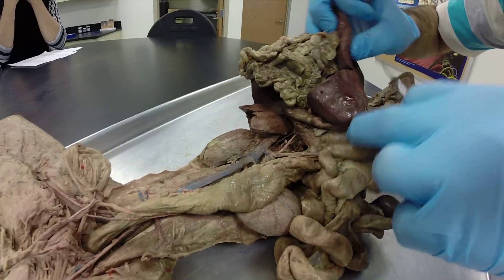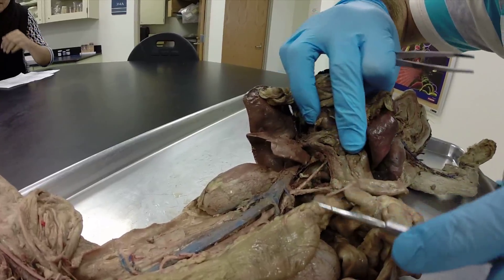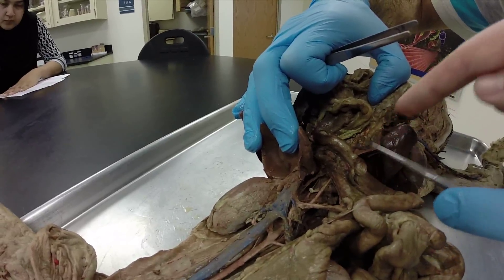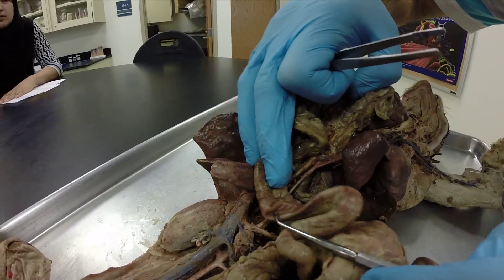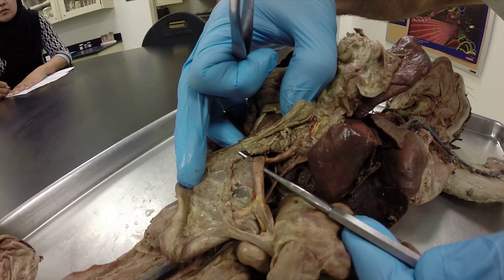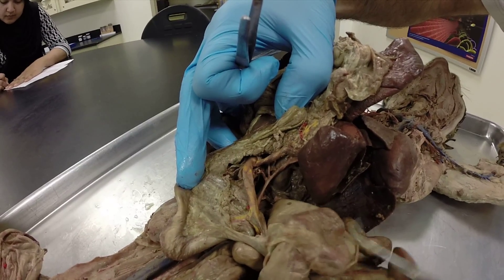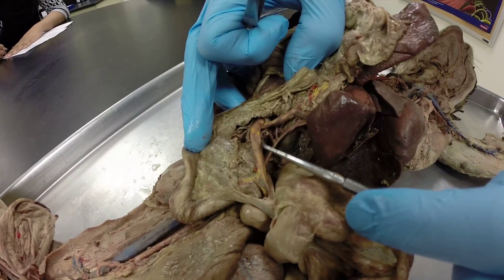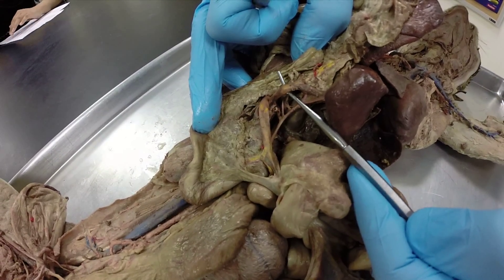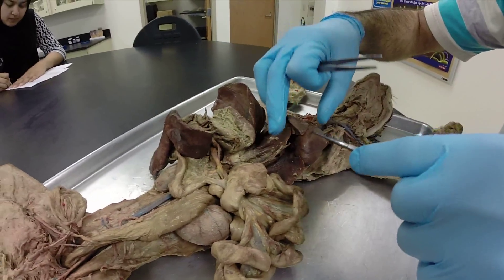We also have the hepatic portal vein in here — we pay extra to get some of these cats dyed in yellow so you can see it. The hepatic portal vein brings blood from the small intestine, carrying just-absorbed nutrients, and takes it to the liver to be distributed. That's the portal vessel — our hepatic portal vein.